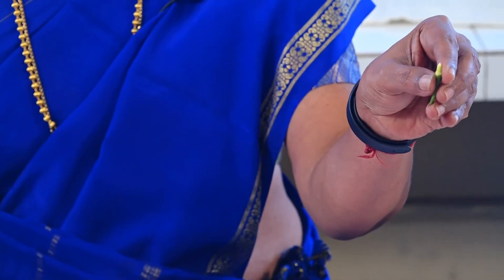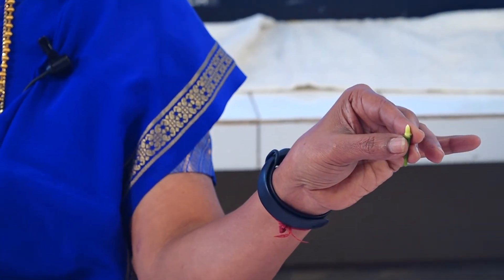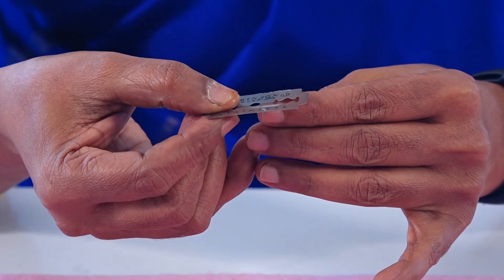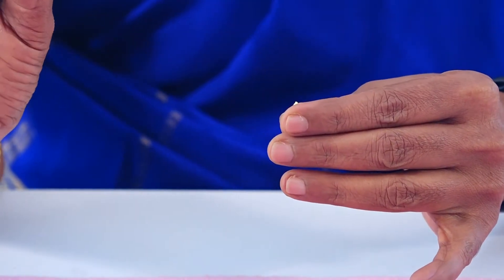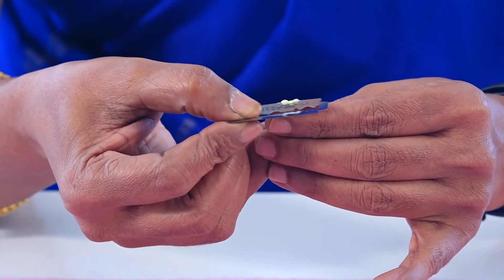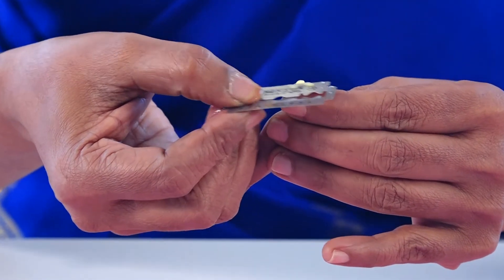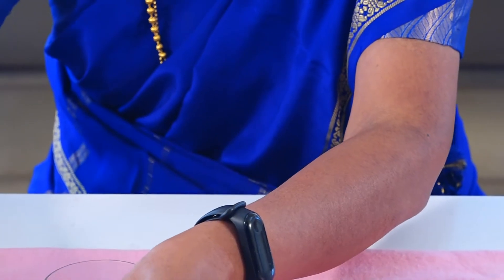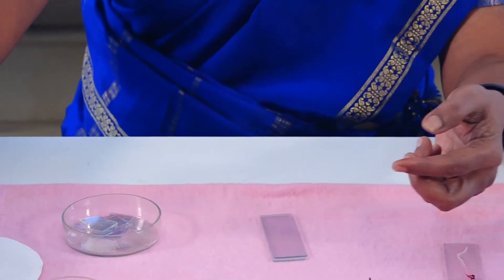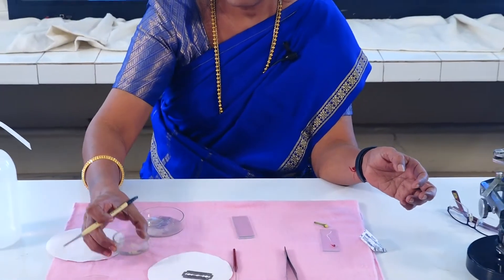To avoid injury, always keep the thumb below and the index finger above when holding the ovary. Pass the blade over the material. Just pass the blade over the ovary and take thin sections. You will find thin sections. These are the sections we have taken.